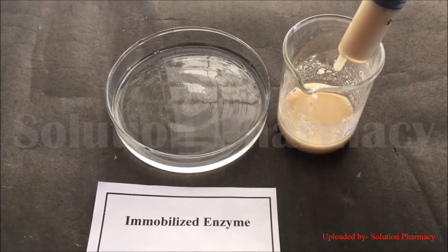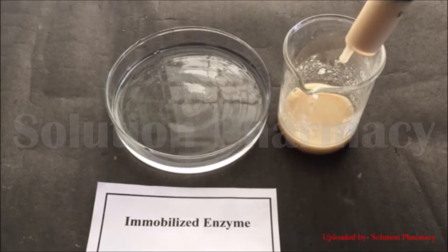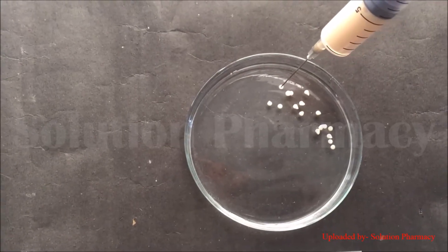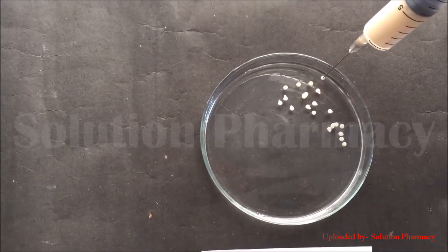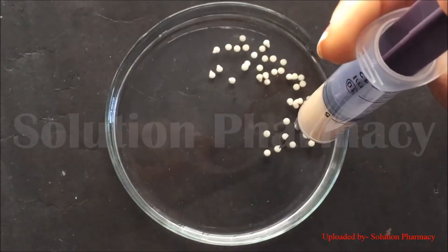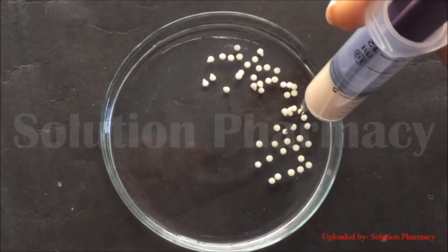Then take the suspension of yeast cells in sodium alginate — the mixture of sodium alginate and yeast solution — into a plastic syringe, attach a needle to the syringe, and transfer the mixture drop by drop through the syringe into the petri dish containing calcium chloride, held about 2 cm above the petri dish.